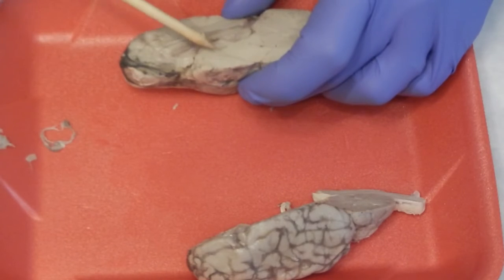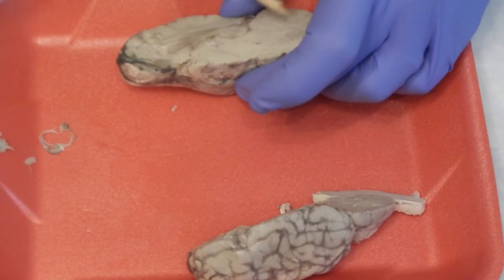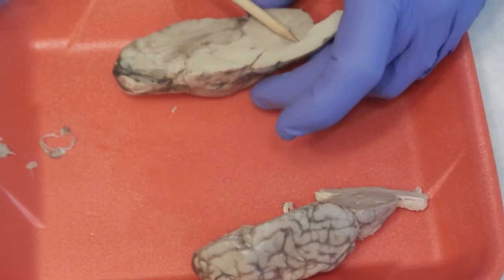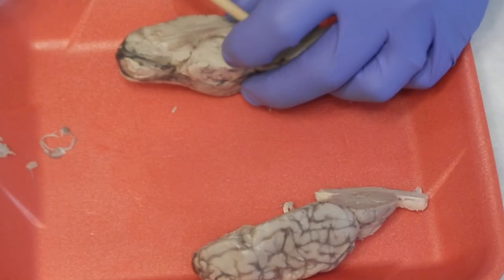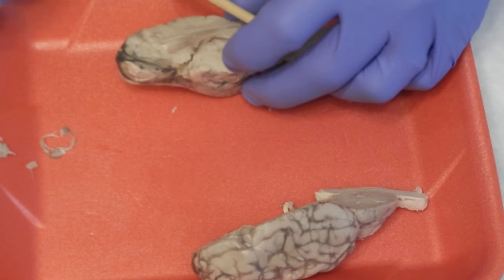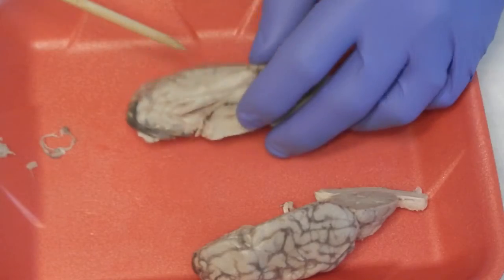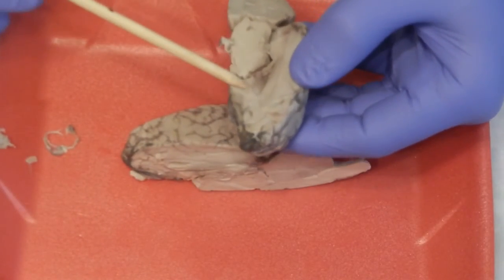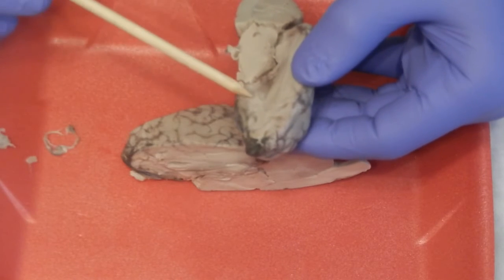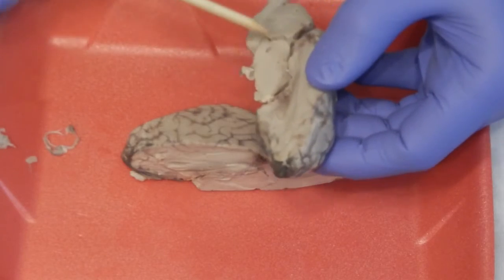All of this is actually housed with different ventricles that help with cerebrospinal fluid. And this is the central canal that comes up by the fourth ventricle. If you follow it and go down, 4, 3, 2, 1, you'll have the fourth ventricle, the third ventricle, and then the lateral ventricle. Let's see if we can see it on an easier side. It looks like it's easier to see on the other side. Then you have, of course, that fibrous tissue that connects both hemispheres of the brain, called the corpus callosum.